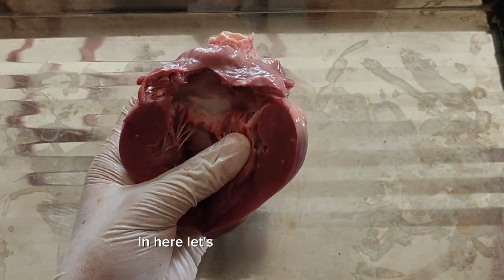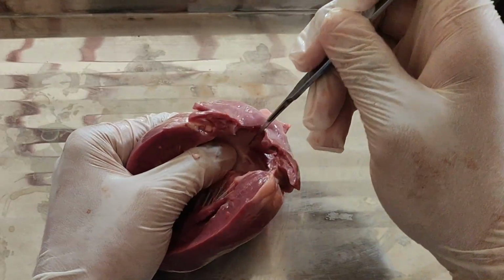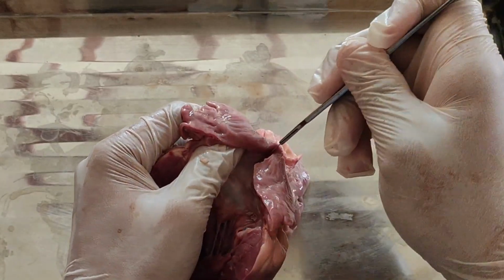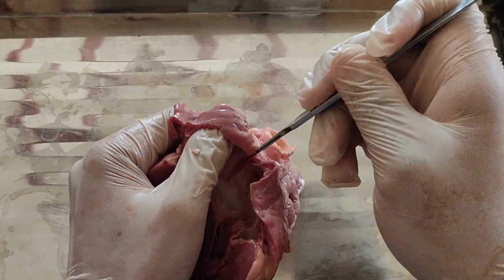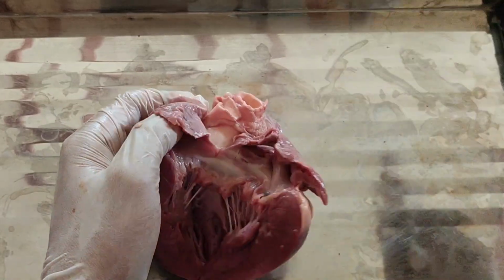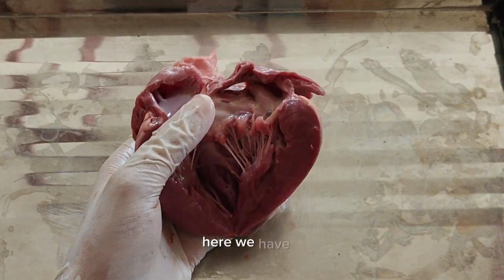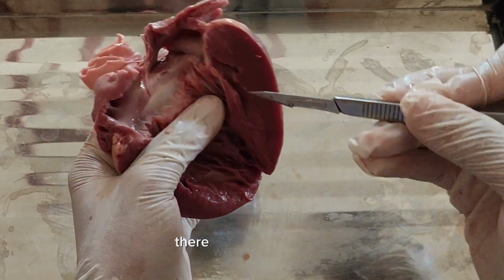In here, let's open the atrium too. Just cut it open. Gently. Try not to cut yourself, everyone. Safety first, okay? There we go. Better view.